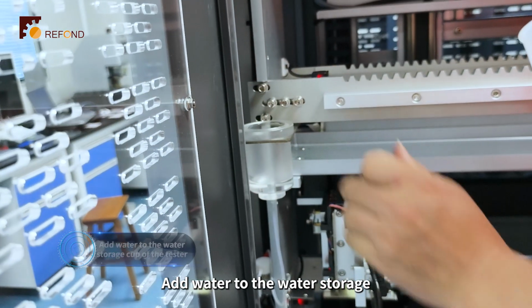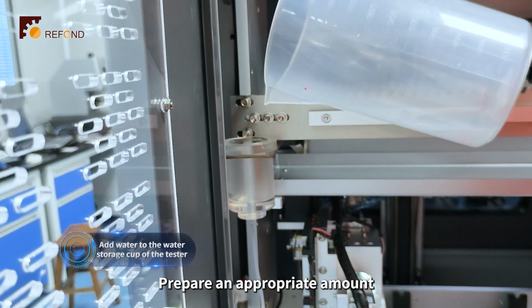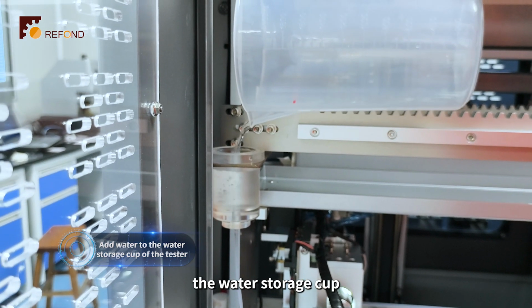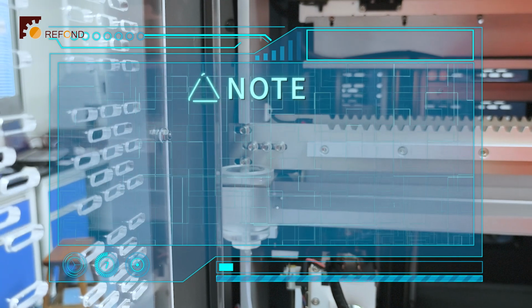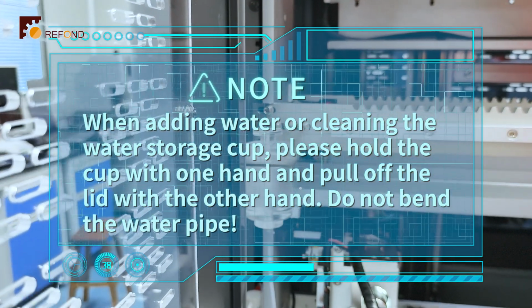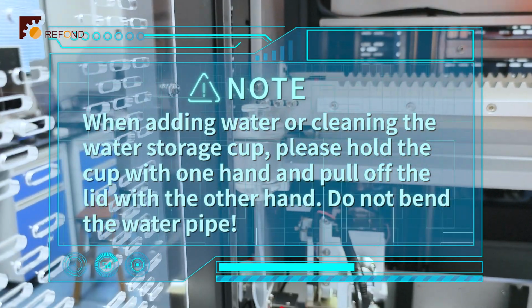Add water to the water storage cup of the tester. Prepare an appropriate amount of purified water and add it to the water storage cup. Note, when adding water or cleaning the water storage cup, please hold the cup with one hand and pull off the lid with the other hand. Do not bend the water pipe.